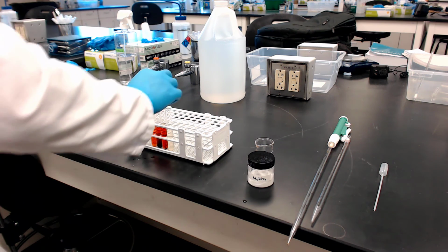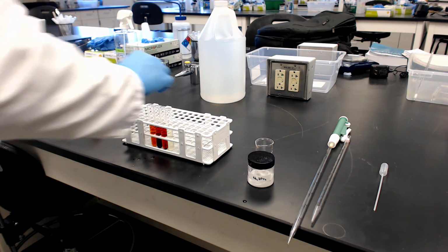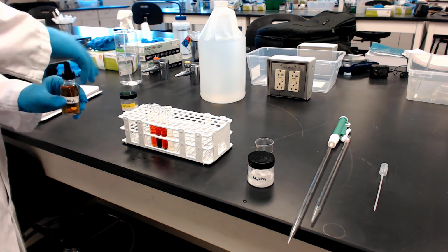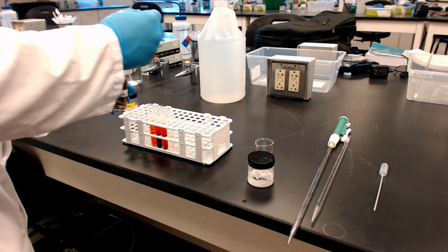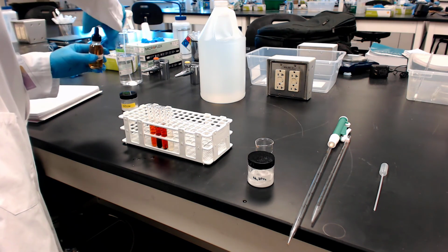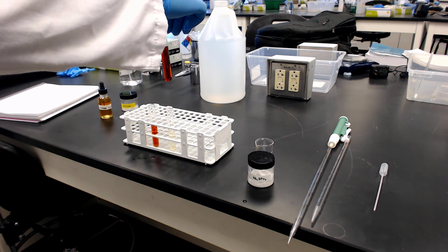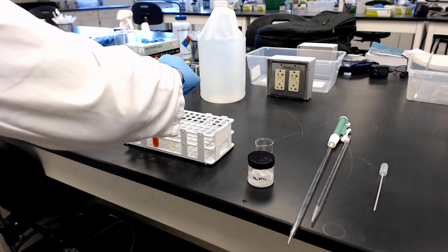The next one over is where you added the thiocyanate. Then the next one over is where you added the iron 3 plus, which he's kind of running back through and redoing. And then the last one is going to be the crystals of the sodium hydrogen phosphate.